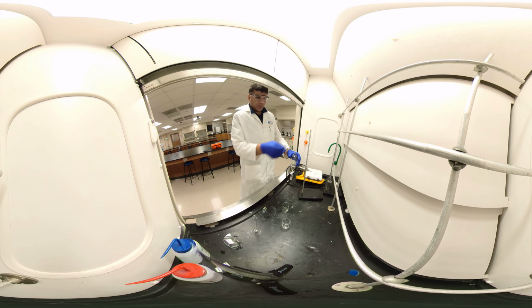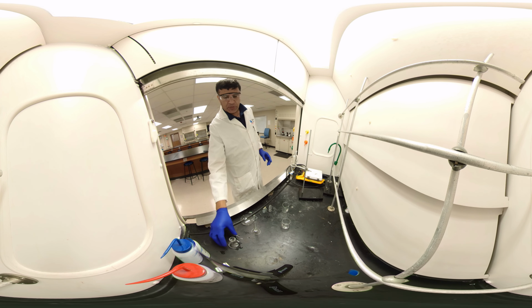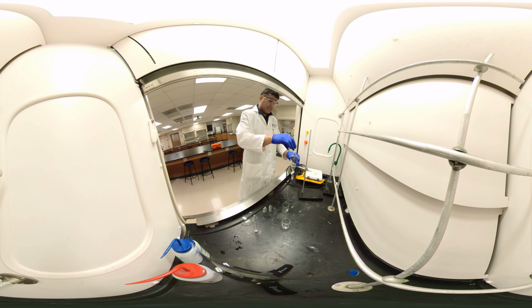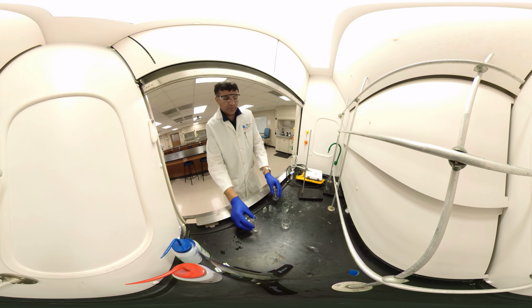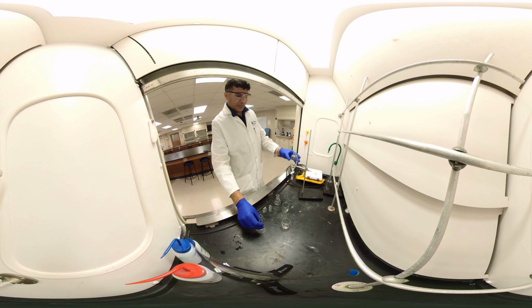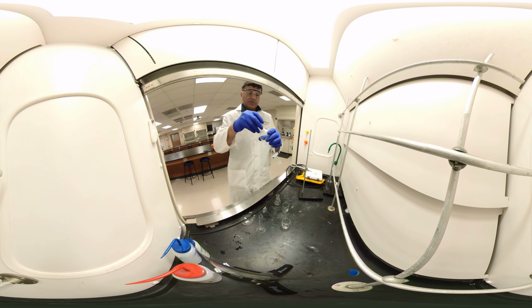Everyone, we were working on the separation of Goody's powder, right? Extraction. So I have the fraction with the methylene chloride. It has caffeine and aspirin. I'm going to extract aspirin with sodium hydroxide. When I put sodium hydroxide, it converts the aspirin to the salt, and I will just pour it here. Also, 2 layers. I added sodium hydroxide, then swirl it here, okay?